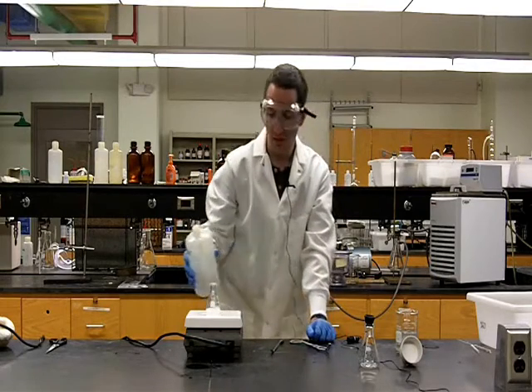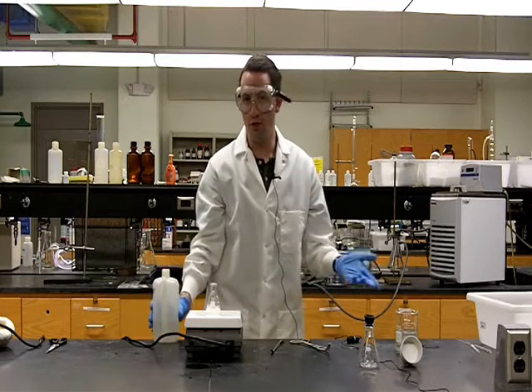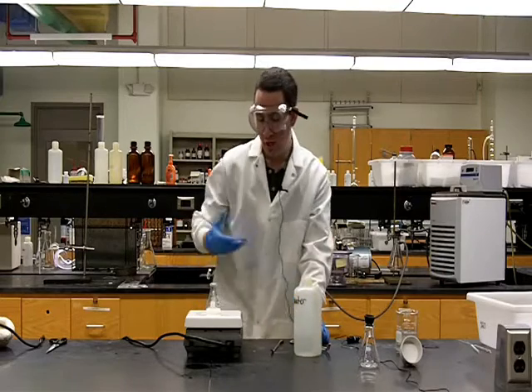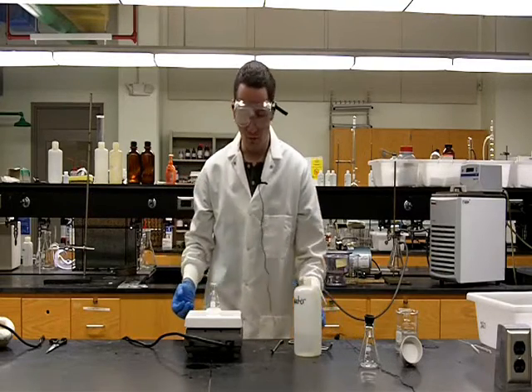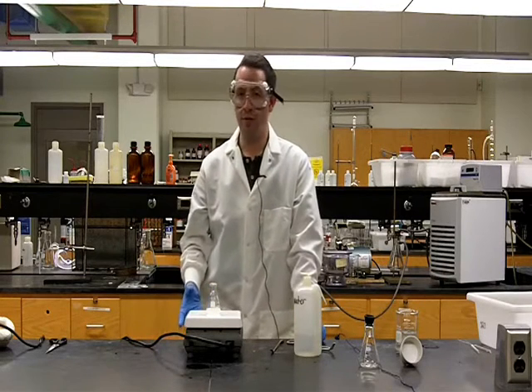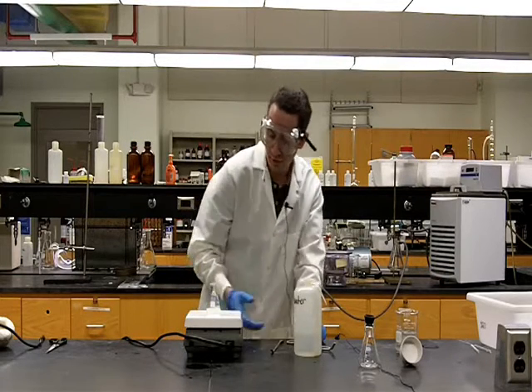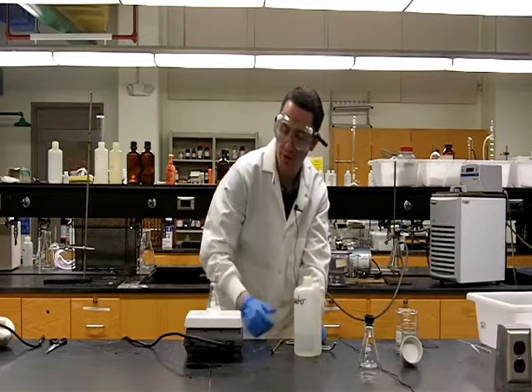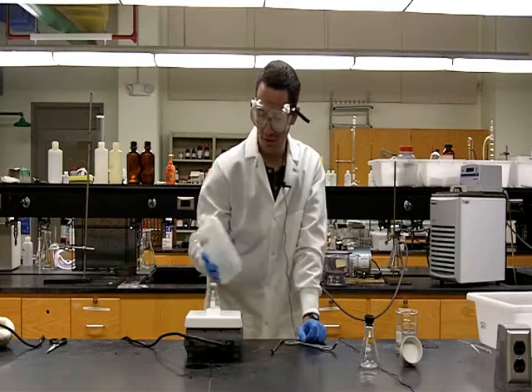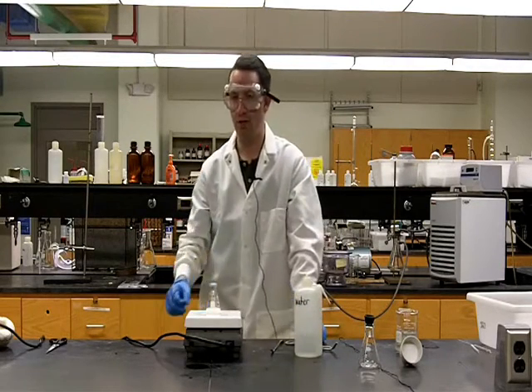Again, we come to a boil, it's not completely dissolved. We'll know it's completely dissolved because it'll look like water does normally, as just a completely transparent solution. So again, we'll add an additional quantity of water. When you're doing this, you do not need to carefully measure out these quantities during a recrystallization. As you can see, as we come to a boil this time, our solution is starting to clear up, but we're not completely there.